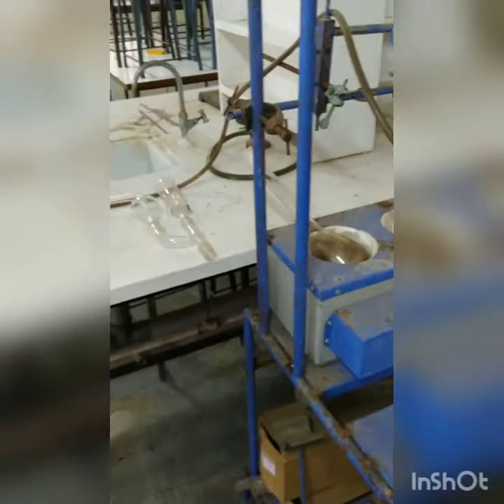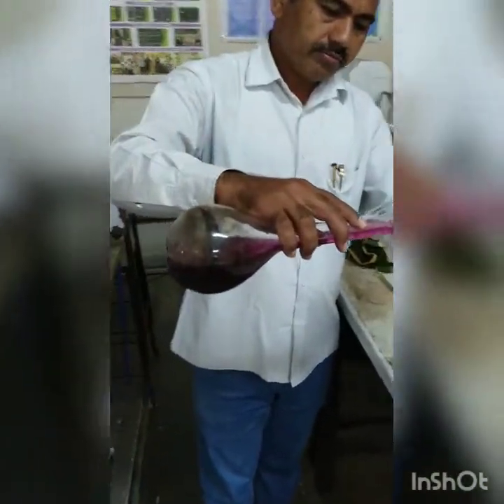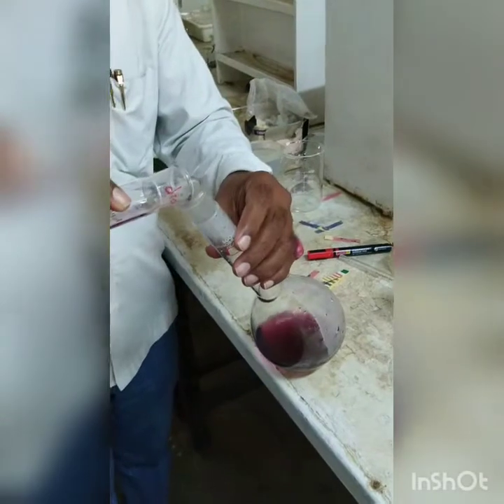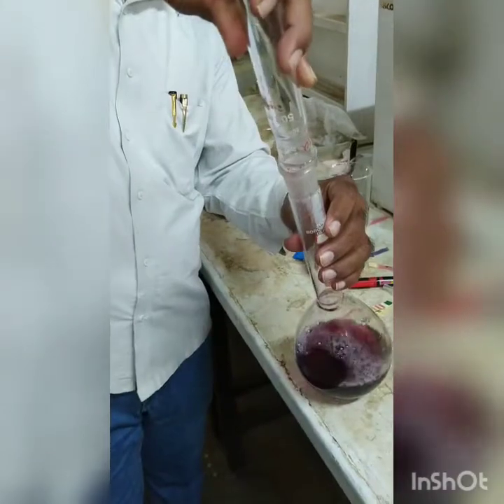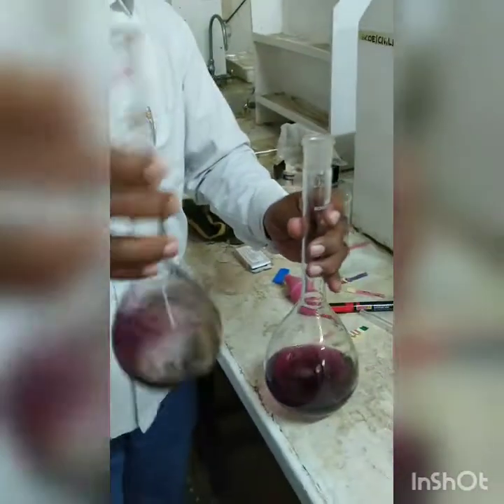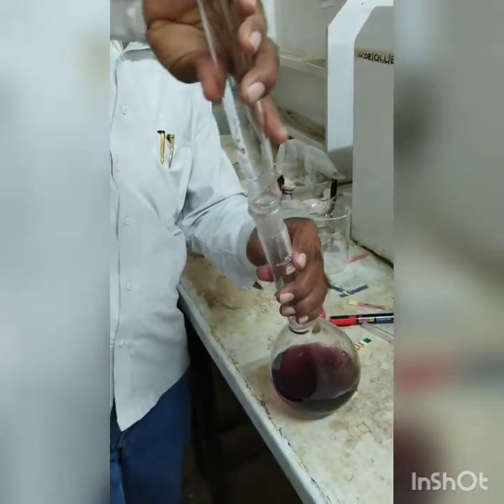Okay. So now we are going to transfer those contents into the distillation flask. So Ingole sir is taking the distillation flask, and you can see that from the digestion flask now, special kind of distillation flasks are used. So already we have done it for the blank sample. Now we are doing it for the digester sample, and the same procedure will be done for the grey water as well. Now I am not going to show you the procedure for the grey water. Grey water we will directly put in the distillation assembly, and now from all the 3 distillation flasks we will collect the distillate.